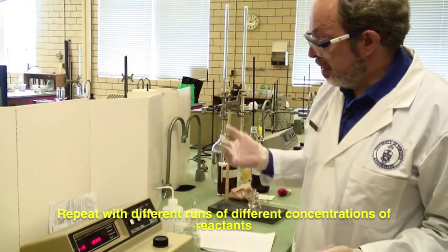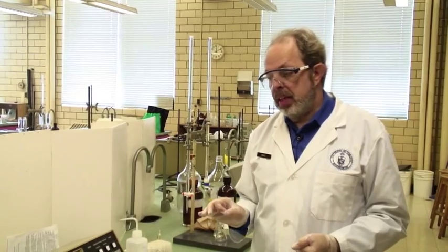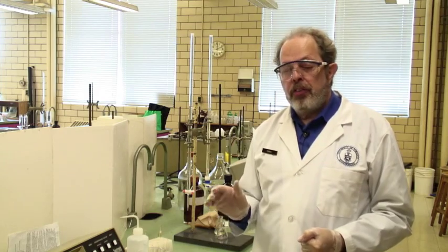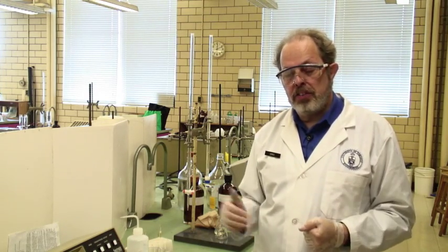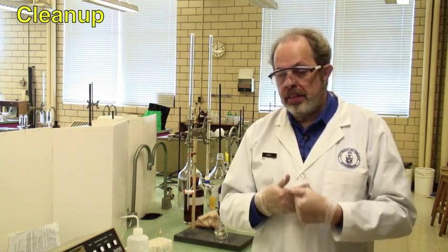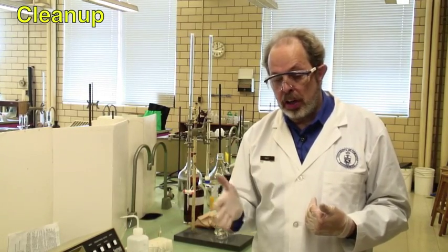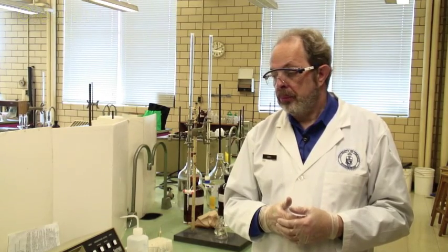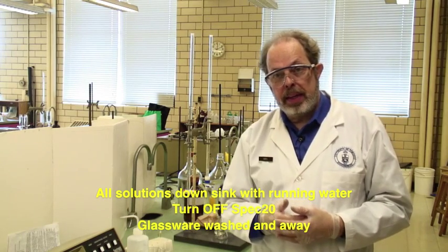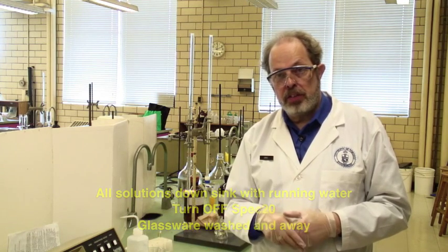The reactions will have slightly different proportions of reactants. For A, B, and C, you're changing the initial concentration of iodide. For D, E, and F, you're keeping iodide constant and increasing the concentration of peroxydisulfate. In all cases, it's the same reaction — it will produce iodine, and the solutions will go darker brown with time. That is how you perform the kinetics of peroxydisulfate-iodide as monitored on a spectrophotometer.